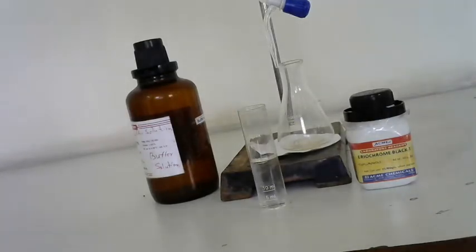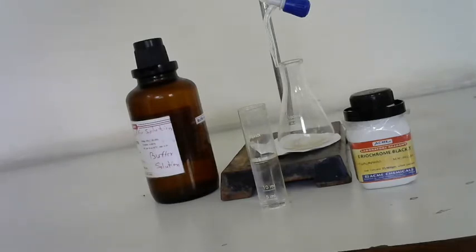Okay students, today we have to determine the hardness content of the water sample in terms of calcium carbonate. Now you already know that water can be distinguished in two categories, soft water and hard water. Water which does not produce lather readily with soap solution is known as hard water. Hard water, on heating, leaves deposits of scales on the walls of the container. Therefore, estimation of hardness of water is done before using water in the boiler for steam generation.